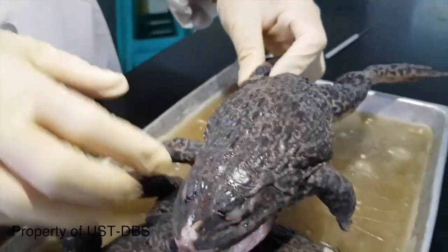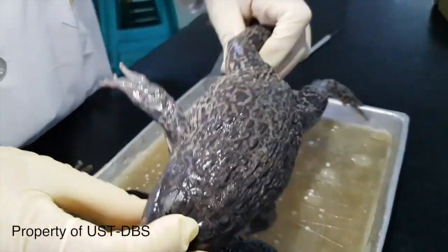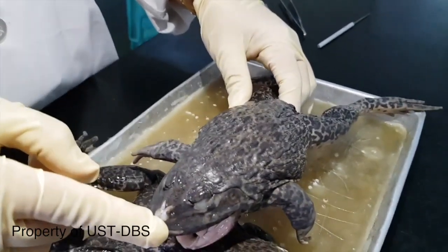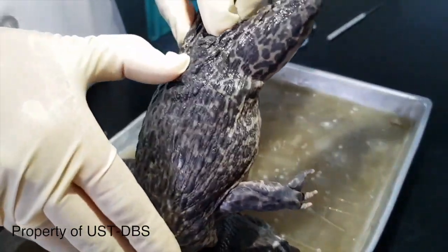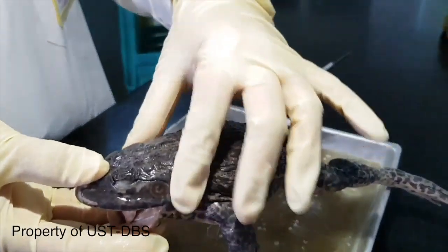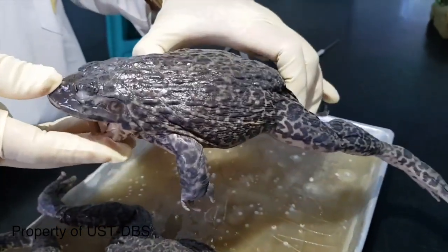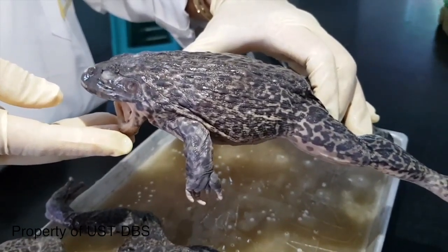So this is the dorsal side and this is the ventral side. On the dorsal side, it has a pointed snout here, and this is the vent where the cloaca is located. No mobile neck is present for class Amphibia. So this is tailless. Other groups of amphibians have the presence of a tail.